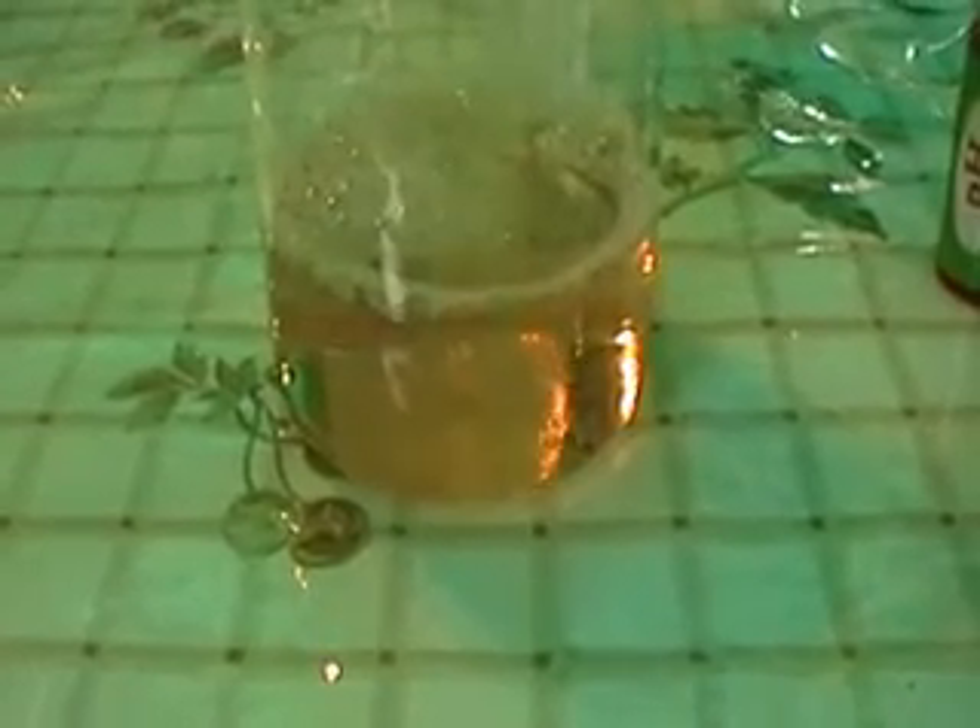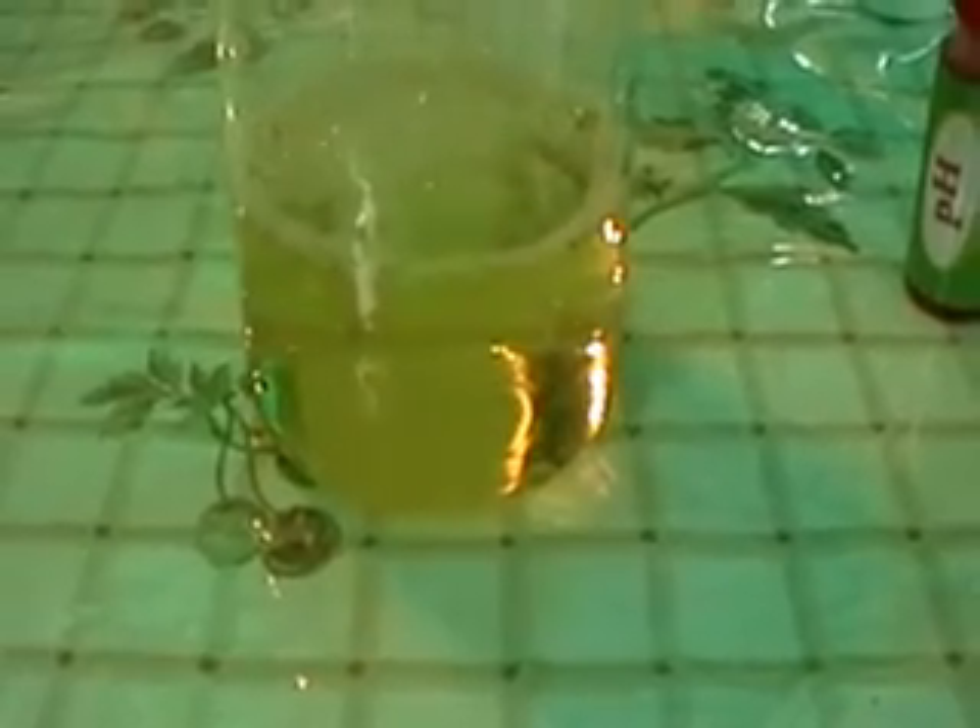Just for our purposes here, I'll continue to pour this ammonia in so that you can see a more vivid color change. You can see it's getting a lot more red now. We can even reverse this process by putting in more vinegar — and now pay attention to the color here — now it's getting yellow. That's what a pH indicator does.